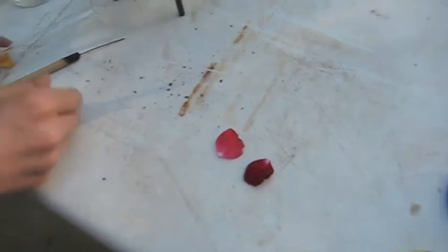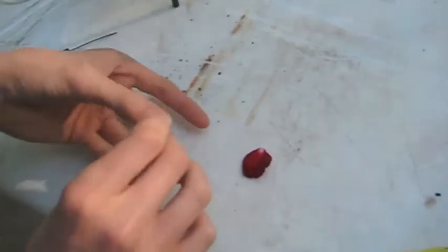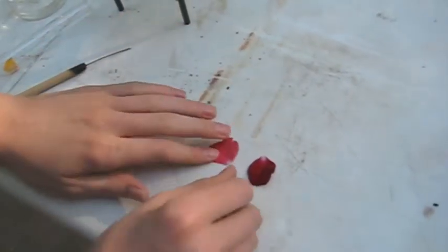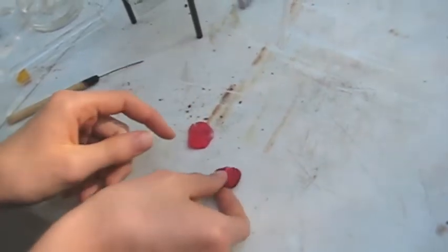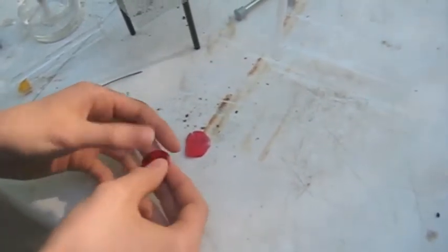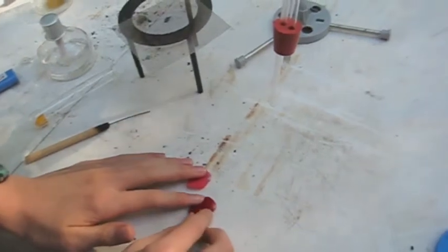This is because sulfur dioxide breaks down most natural plant dyes. It can also be used as a bleaching agent for other things. Now sulfur dioxide is poisonous so if you do try to perform this experiment it must be done outside. Pretty cool huh?